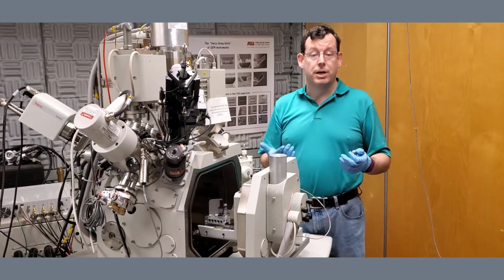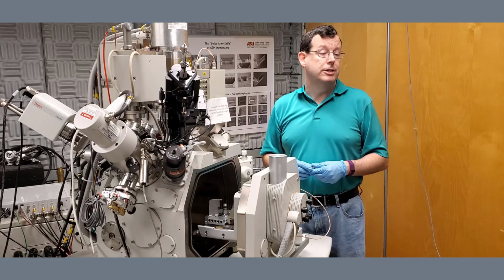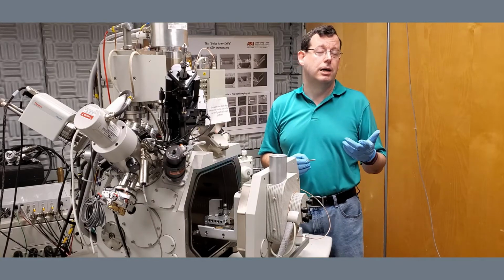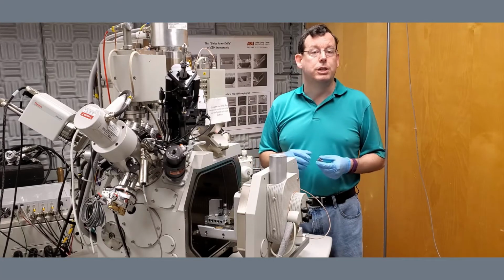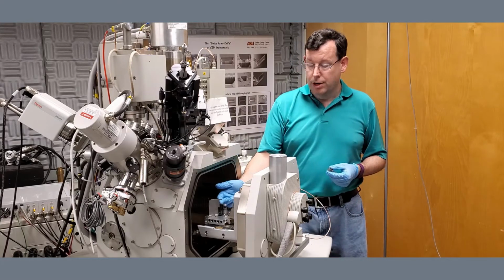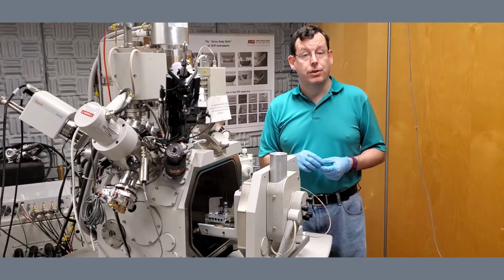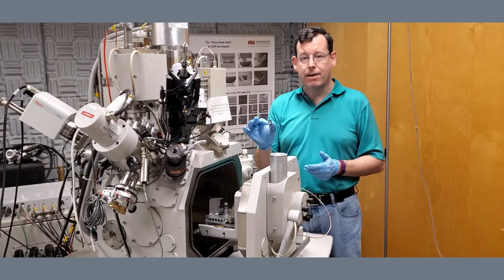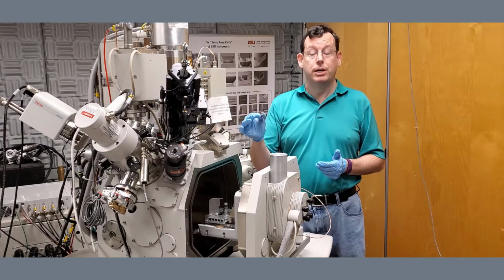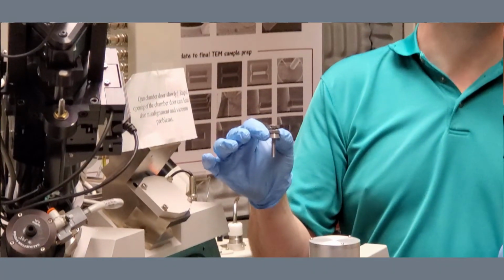Now, sometimes if you're coming in here, you may have a particularly large sample. Let's say that you're doing a graphite puck. Those often are close to 1 inch tall. Those will not fit on the standard stage holder here and still fit underneath the height measure. For that purpose, we actually have a special half height section that can be put in and will get you about another 10 millimeters of height that you can use.